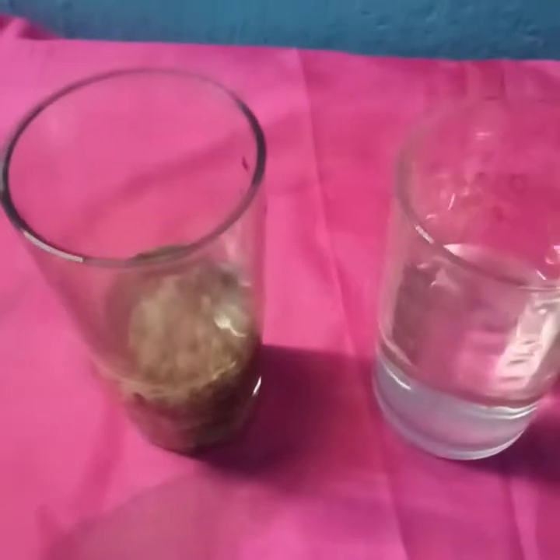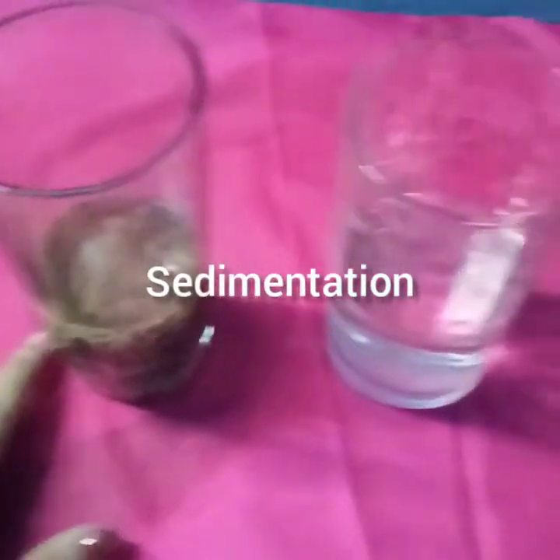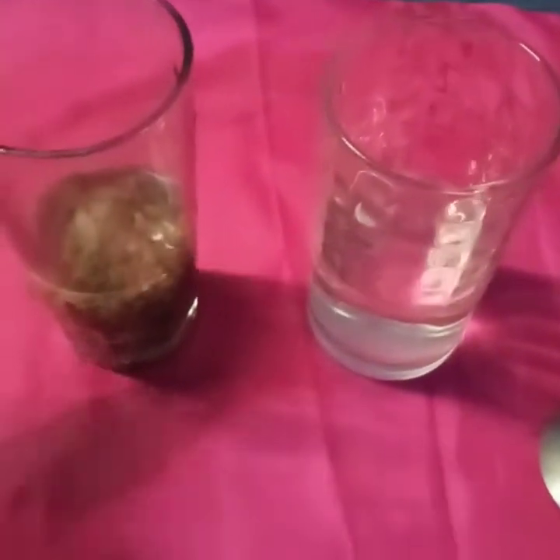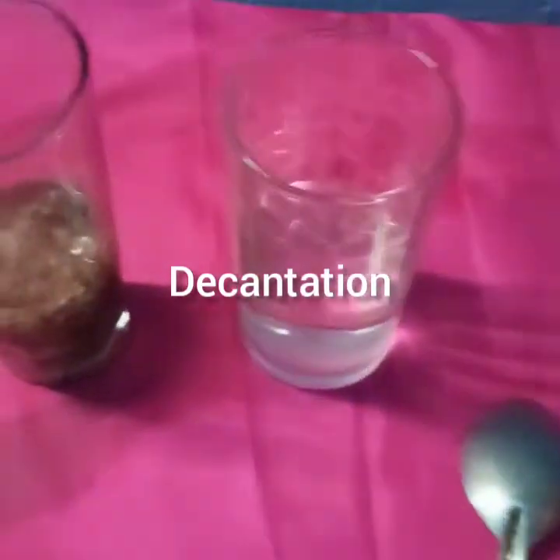So we have studied what is sedimentation and what is decantation. The process in which the sand settles down at the bottom is called sedimentation, and when we pour out slowly the water that was above, that is called decantation.